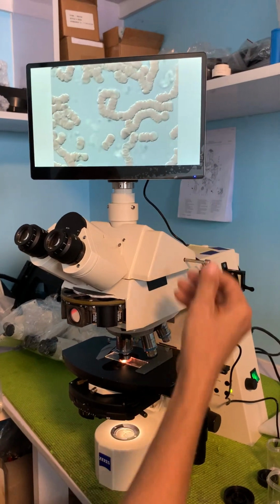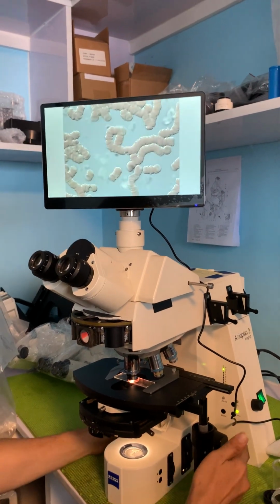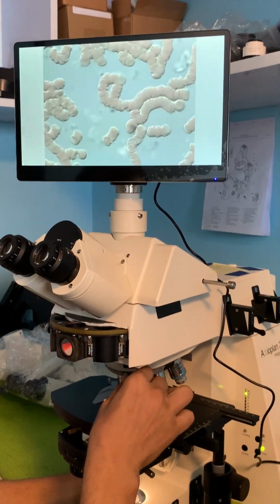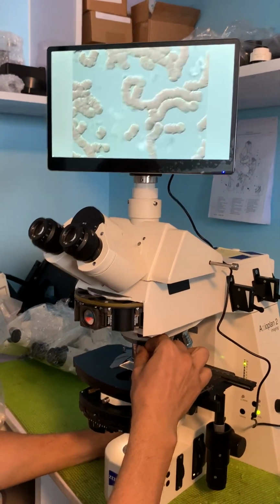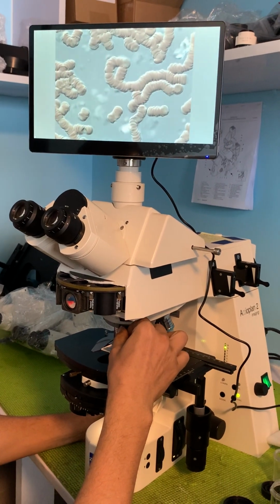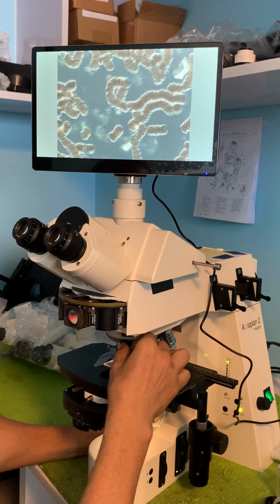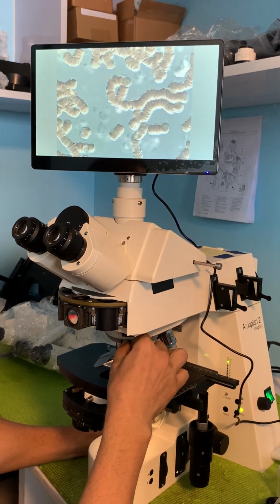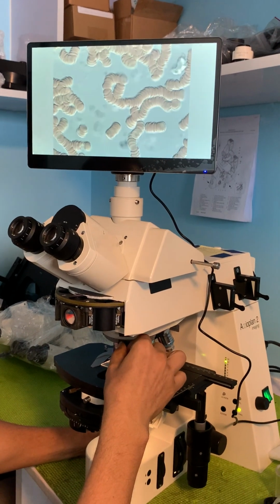And you can see in the image, you can see the red blood cells. So this is currently looking using DIC. And I'm going to rotate the DIC prism, the knob on the DIC prism, which changes the shear plane. We're going through a pseudo dark field at this point, and then we're going to go to the other side of it, just keep rotating it.